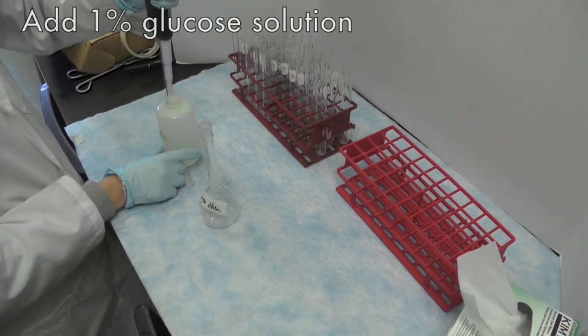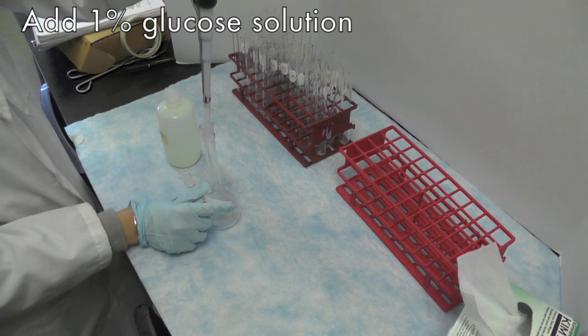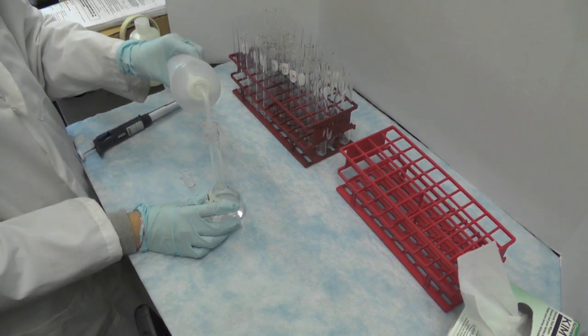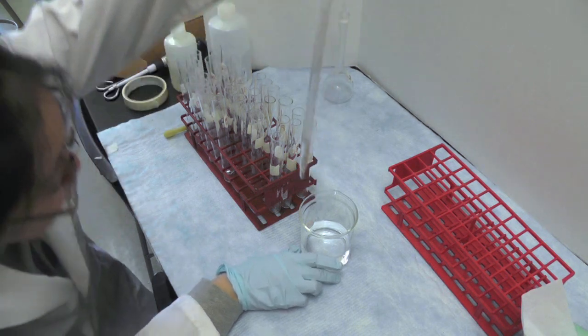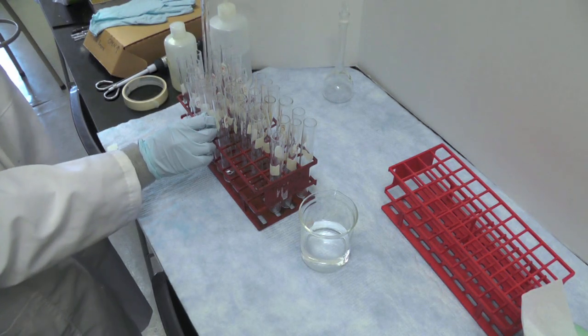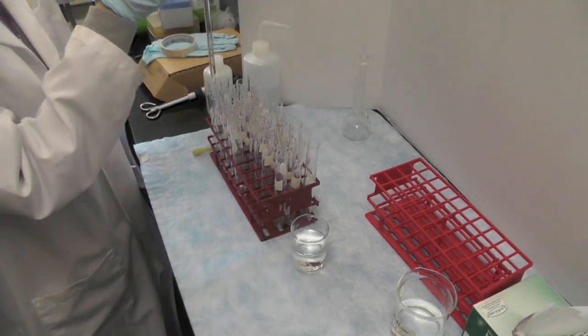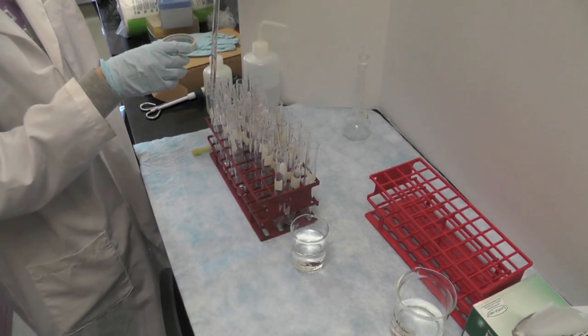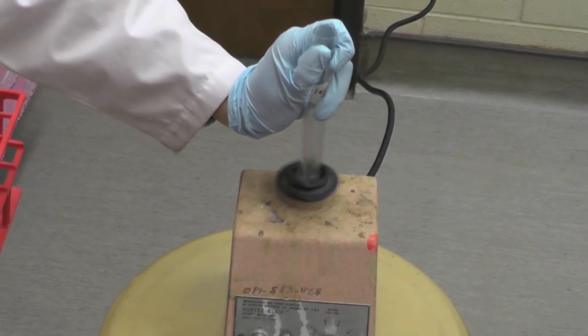Prepare the standards for the phenol-sulfuric acid method as follows. Prepare a 100 microgram glucose per milliliter solution with DD water, using the 1% glucose solution according to your pre-lab calculation. Prepare 10 ml of 0, 5, 10, 15, 20, and 30 microgram glucose per milliliter dilutions with DD water in test tubes in triplicates. Vortex each tube to mix before preparing the next dilution.